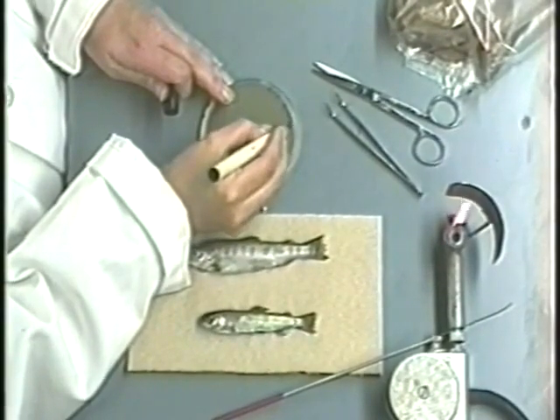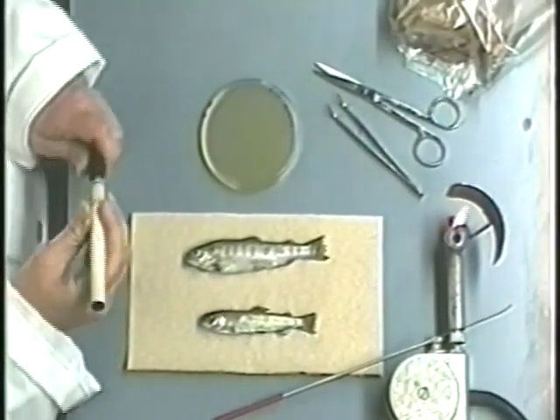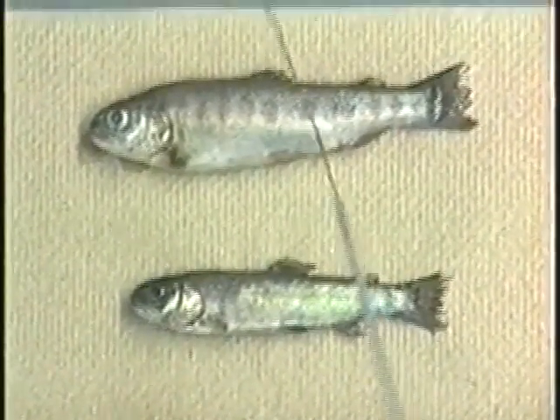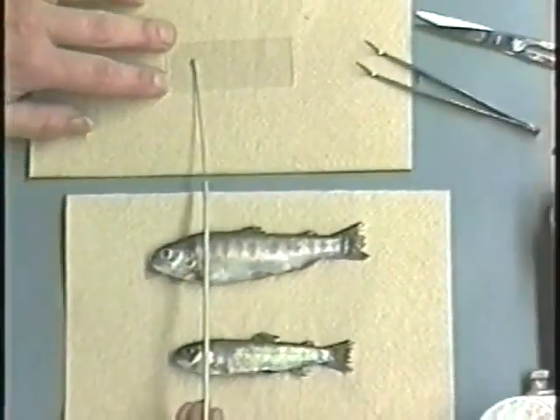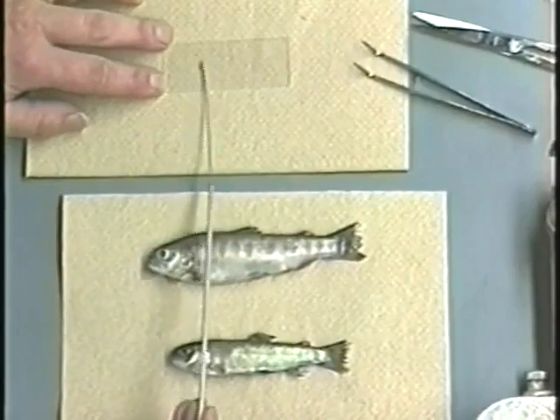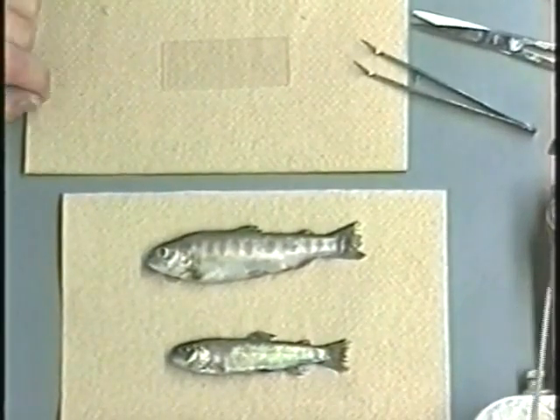In addition to inoculating the sample onto media, you may make a smear to stain. Reflame the loop and insert it into the tissue. Make a thin smear of the tissue on a clean labeled microscope slide. The slide can be air-dried, then heat-fixed for storage.